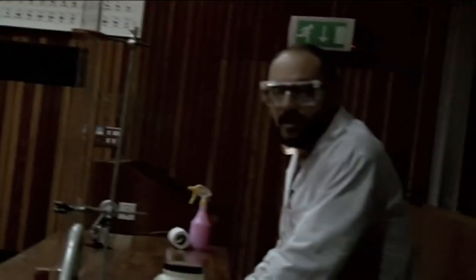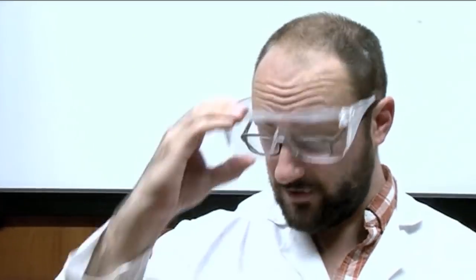Next, we turned our attention to sulfur and one of our favorite reactions here at Periodic Videos: the barking dog. Of course, a fun thing to do with sulfur is to make it bark like a dog. Obviously I'm nervous, but I'm trying to show my bravery on camera. The camera adds 15 pounds and it adds a bunch of bravery. If I was doing this alone, I'd probably have Brady do it.